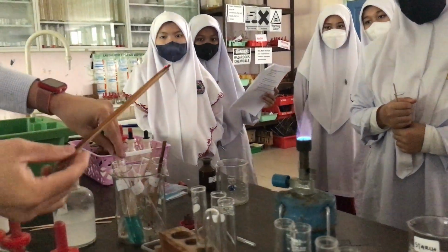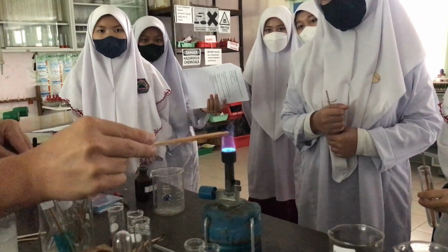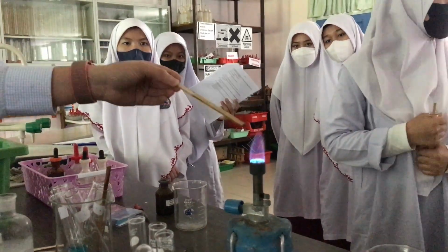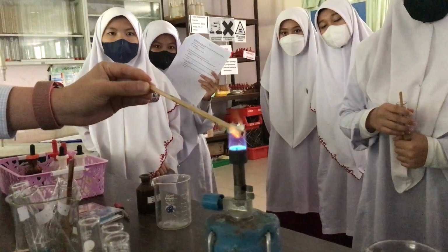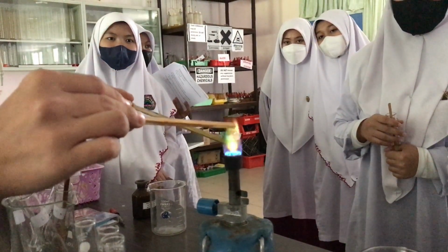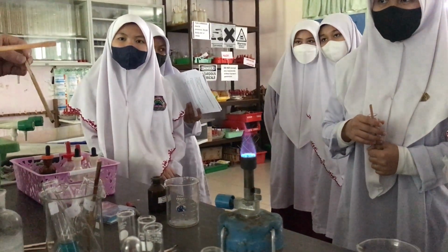Okay. There are some other cool ones, which you don't learn. This is one of the coolest colors you can see, but this one is not in your syllabus. The pure science students, they learn this. Do you see it? Unfortunately, it's not in your syllabus. Do you see it? So these two are not in the syllabus, yeah? You don't have.